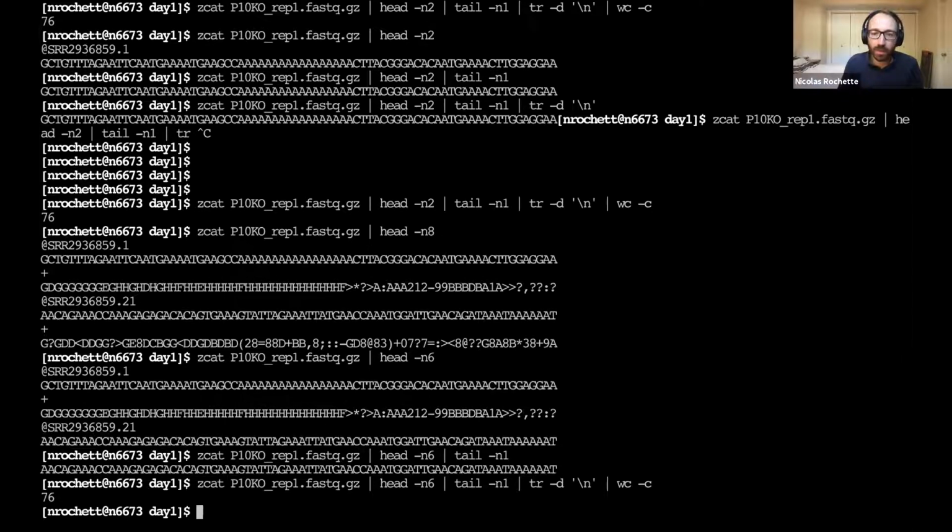Yeah, the big difference between this command and the commands to count the total number of reads is that here we're using this head command to truncate the file. And right away, this file has how many lines was it? It was 9 million lines. And here we're just taking the first 6 and truncating the file. So it's a very big difference compared to working with the entire 9 million lines.